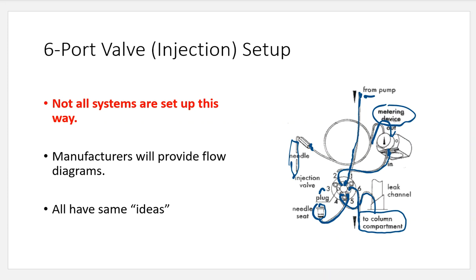So in this video, we're going to talk about what's behind that stainless steel circle. I told you that's what we were going to do in this video, and that's what we're going to do. I'm sticking to my word for a change. So we're going to take off this stainless steel round circle. We're going to pull it off, and there are things that are going to happen in the back.